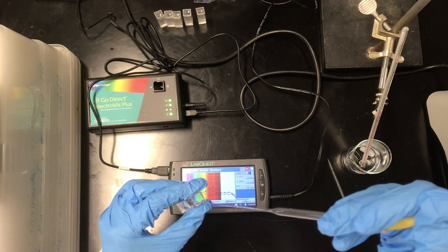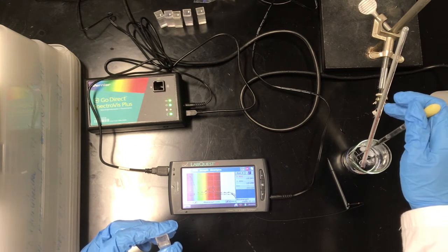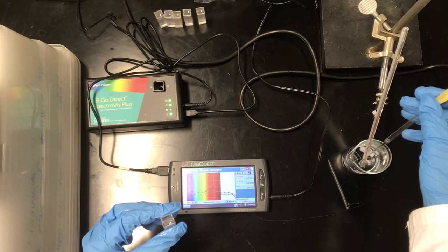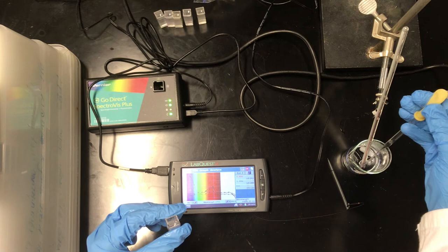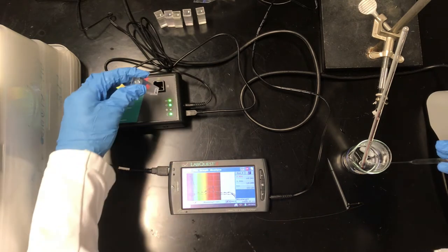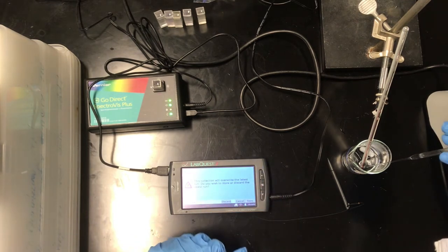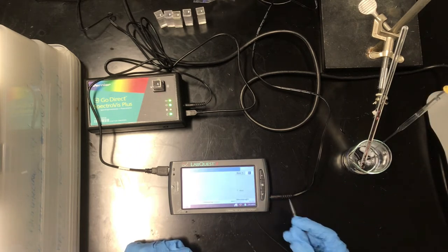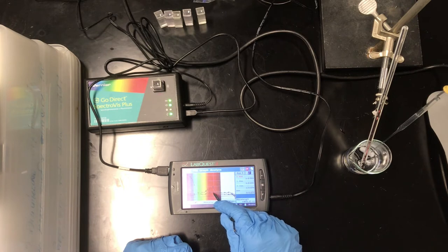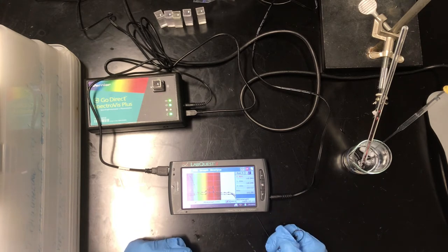So there's a little bit of pink in there, a little bit of blue, and I think we will continue to see the trend in the absorbance around 690 decreasing as the reaction shifts from the product side to the reactant side going from that cobalt tetrachloro complex with four chlorides coordinated to cobalt, to the cobalt 2 plus hex aqua complex, which is the typical pink form of cobalt that you see, for example, when cobalt nitrate is dissolved in water. So there we go, pipetted the solution in, and we're going to again store the latest run so we have that data. And as soon as the new spectrum comes in, I'm going to hit stop here and we can see that if we focus again on kind of the 690 ish region, the absorbance there has indeed decreased as the temperature has decreased.